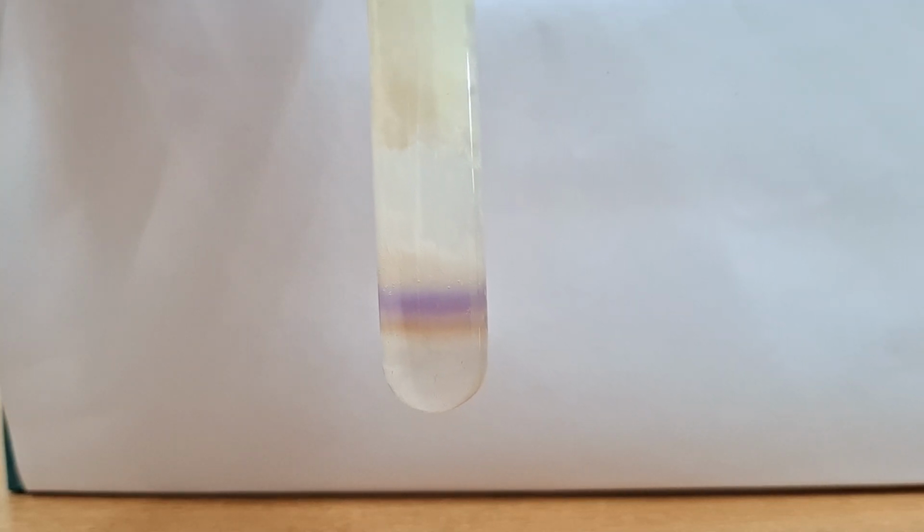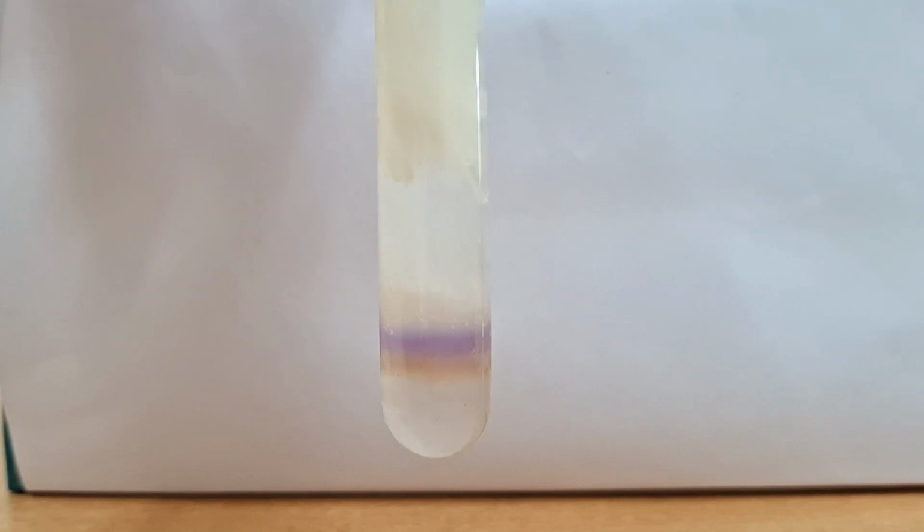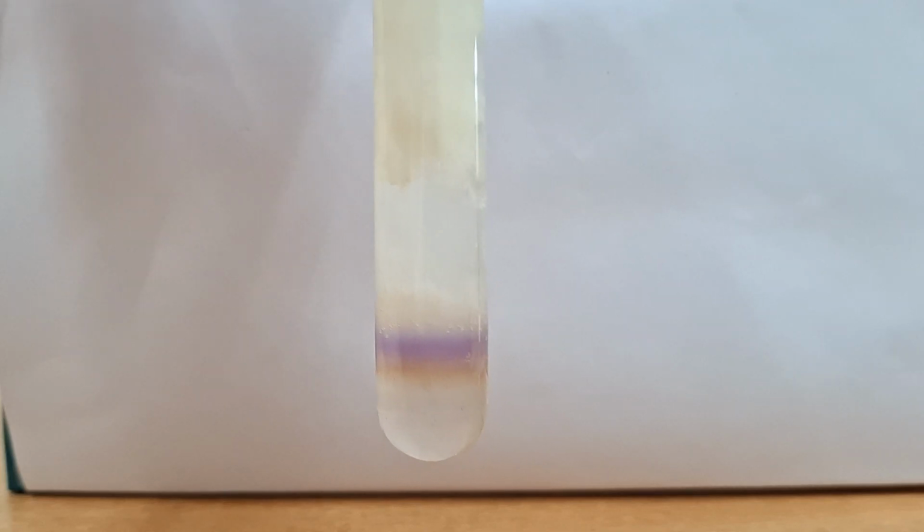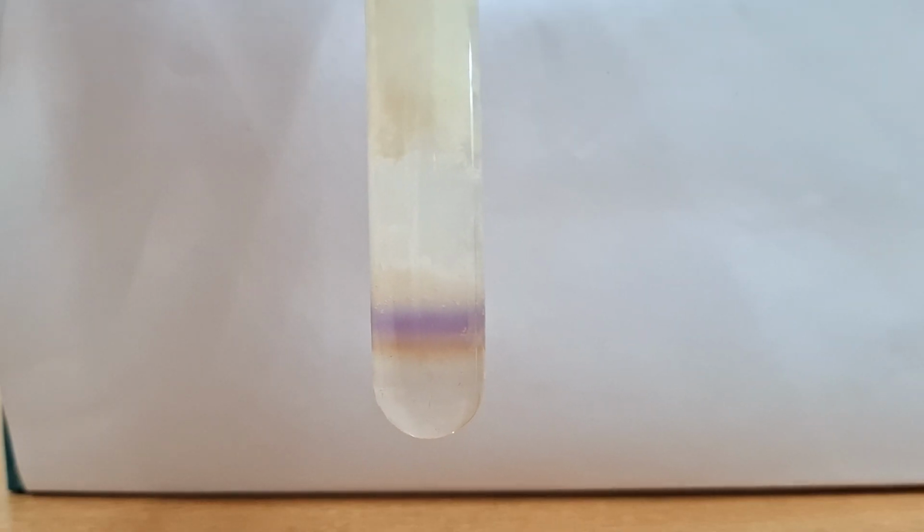So the principle is that the indole ring of tryptophan undergoes oxidation by mercuric sulfate. The oxidizing agent here is mercuric sulfate with sulfuric acid, and the formaldehyde will react with the oxidized product of the indole molecules to give a violet color complex. So why is the violet color complex formed? The oxidized product of the indole ring gives the violet complex color. This is also known as the Hopkins-Cole test. So tryptophan is positive in this particular case.